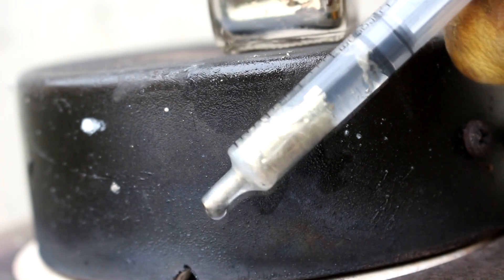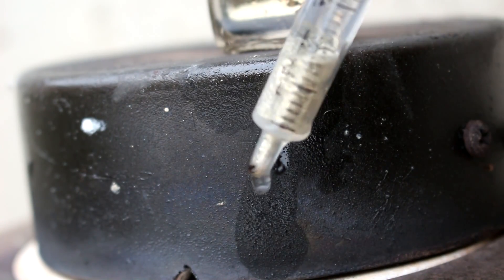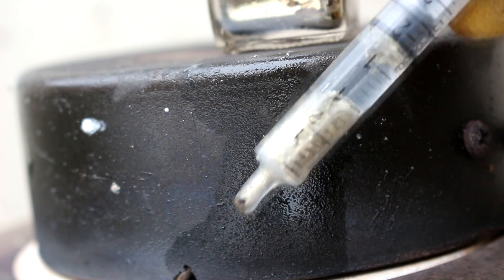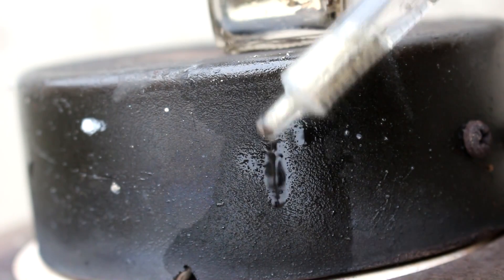Look at how beautiful this is. It looks almost exactly like gold except that it's a liquid. Isn't that cool? And it also ignites on contact with air. I was amazed at how easy this was to make. I didn't even have to exclude 100% of the air. A little bit of air leaking in and it was still okay.